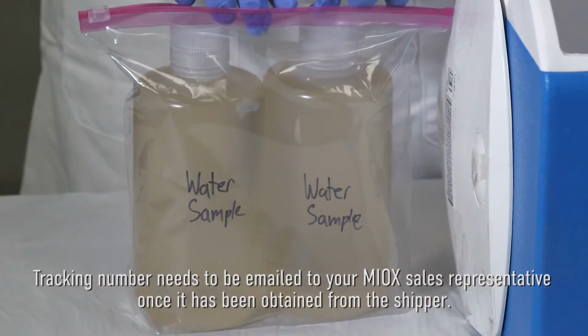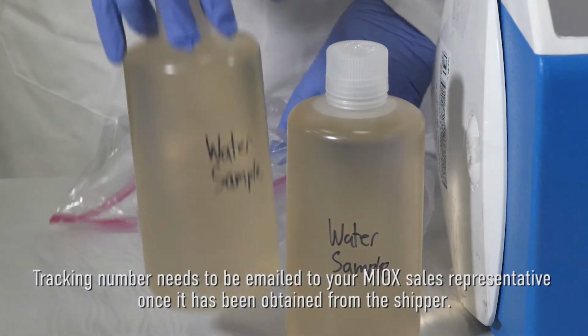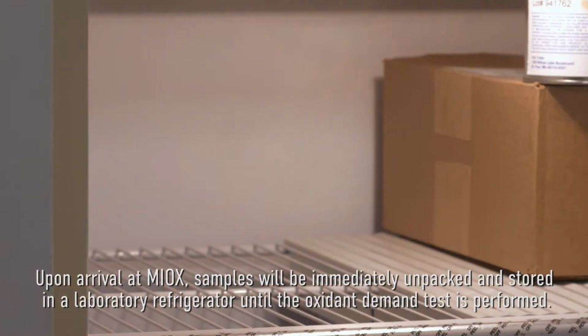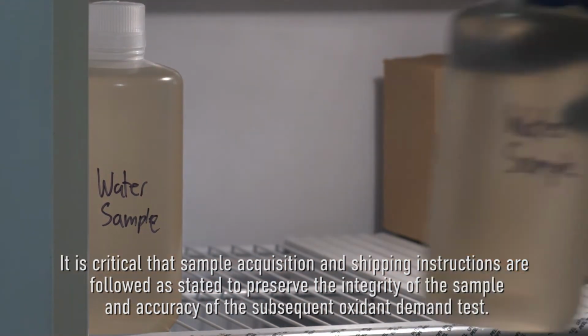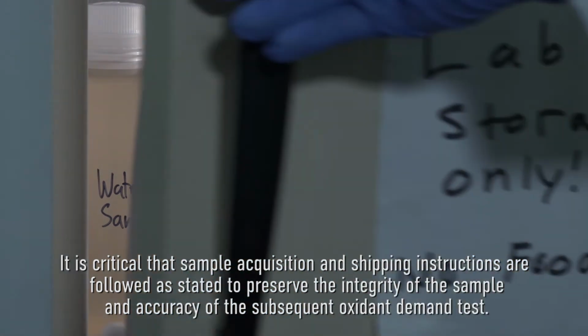Tracking number information needs to be emailed to your MIOX sales representative once it has been obtained from the shipper. Upon arrival at MIOX, samples will be immediately unpacked and stored in a laboratory refrigerator until the oxidant demand test is performed. It is critical that sample acquisition and shipping instructions are followed as stated to preserve the integrity of the sample and accuracy of the subsequent oxidant demand test.